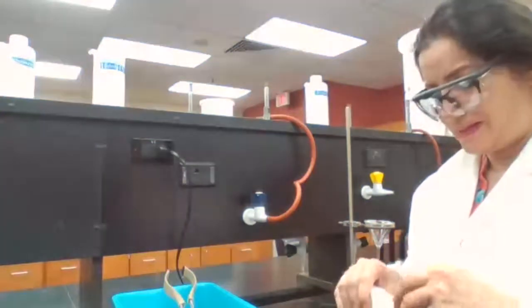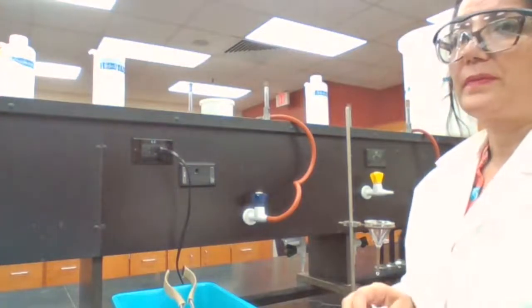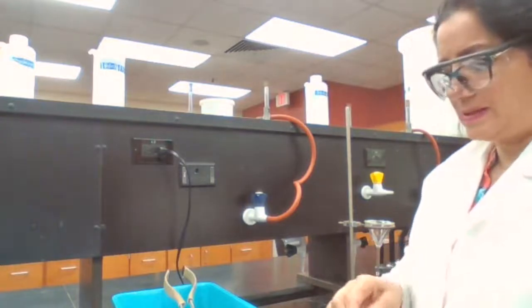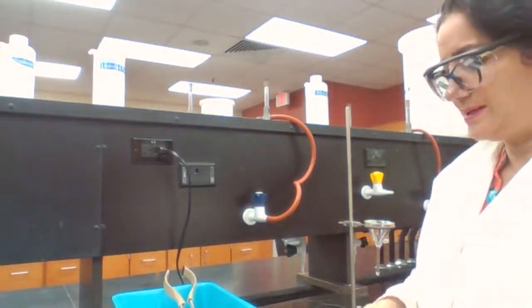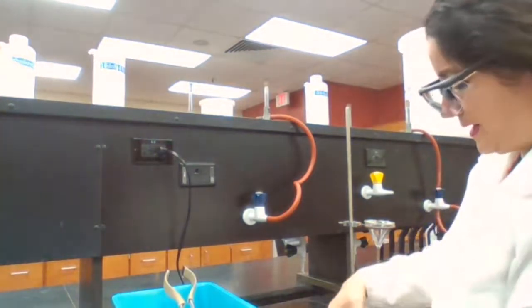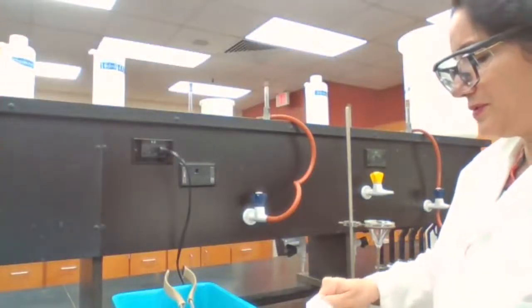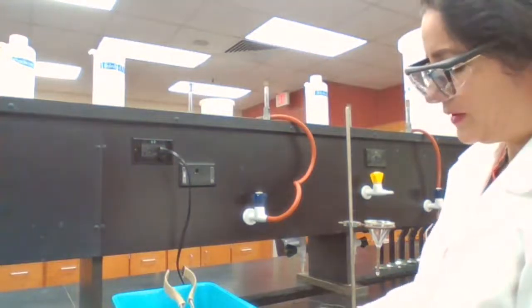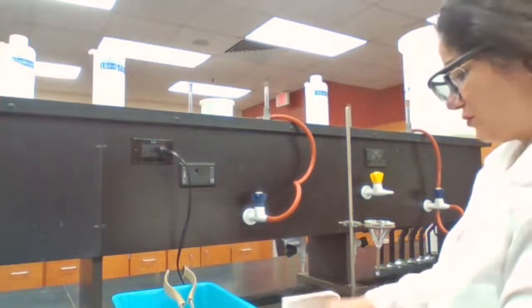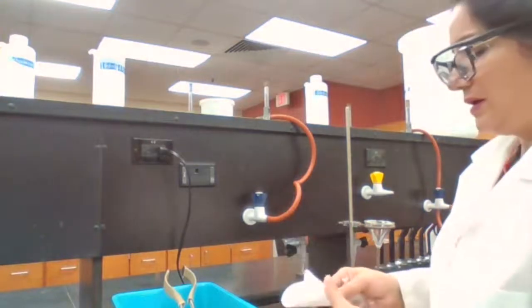There are two ways to separate the mixture of solid and liquid. One would be decanting, and the second is filtration. So you could do decanting and filtration. With the mixture of the solid and liquid that we have for this experiment, I think the procedure calls for decanting. We could replace it with the filtration, or if the procedure is asking to dry it in the evaporating dish, then we have to decant it.